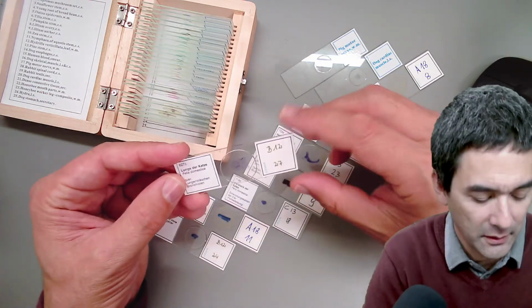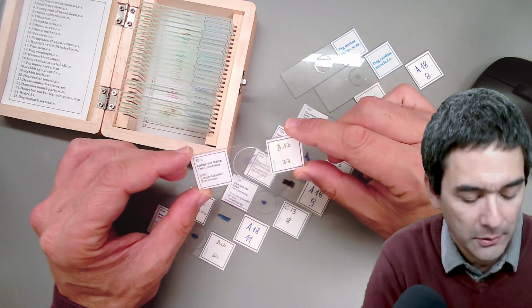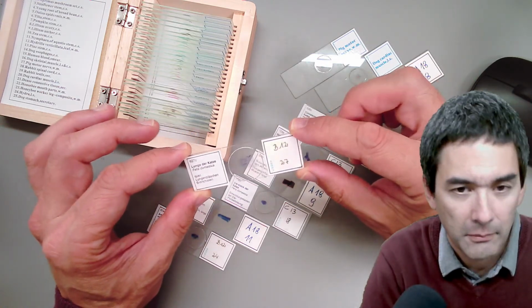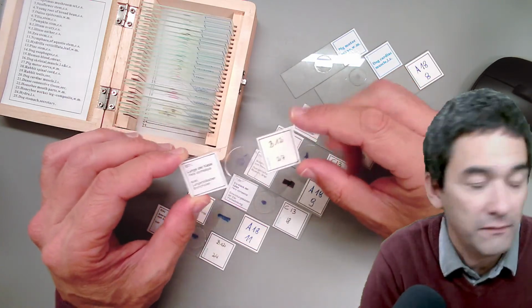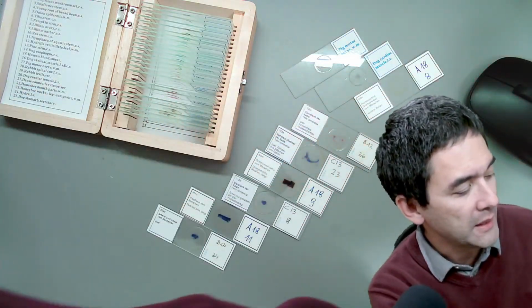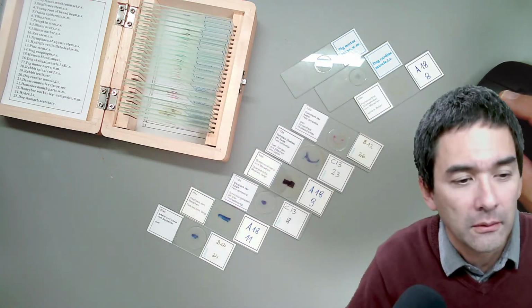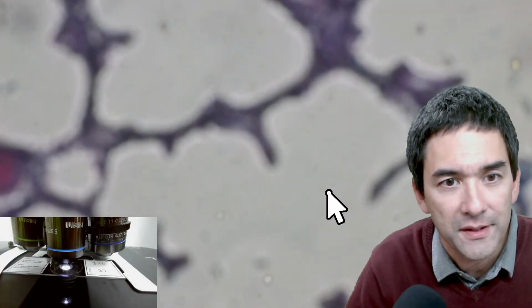This here is the lung of a cat, Felis domestica. And you're able to see the so-called alveoli, the little air sacs. I'm going to explain this as well. By the way, in the upcoming weeks and days, I'm going to post a video in my main channel where I am dissecting the lung of a pig, because a student of mine brought it along, and I'll also be talking a little bit about this there.